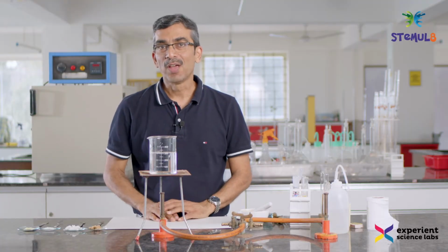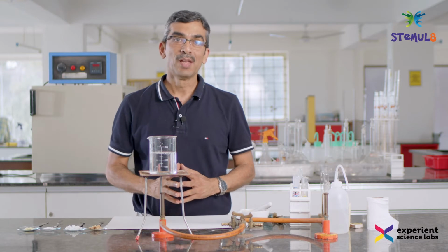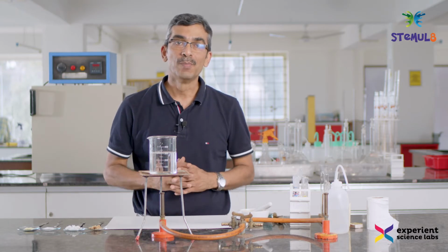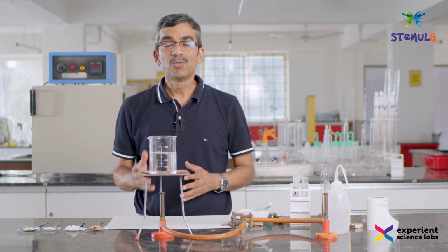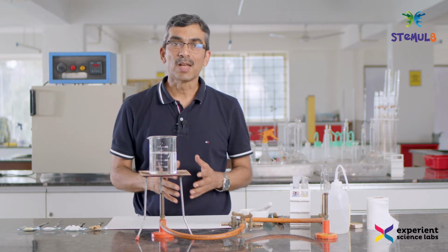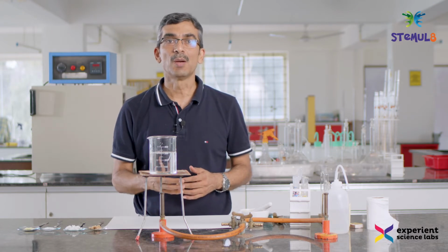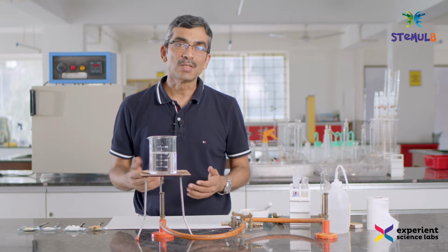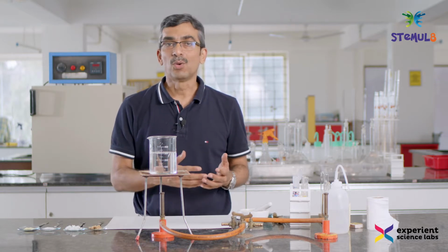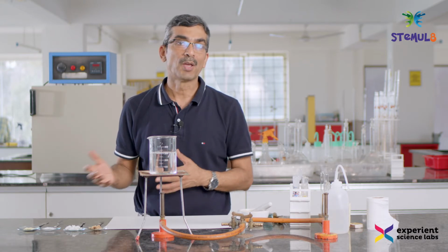Hello students, we are back and this time we are going to perform a very interesting experiment, and this experiment is about food. And what about food? So we want to understand, in the food there are macronutrients and there are micronutrients. When we talk about macronutrients we are essentially talking about carbohydrates, fats and proteins. There are a whole lot of vitamins and minerals that constitute a major bulk of micronutrients.